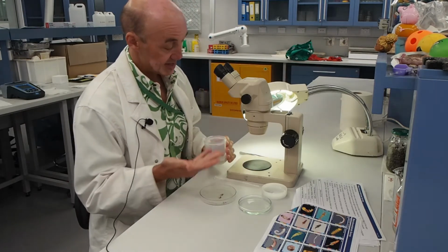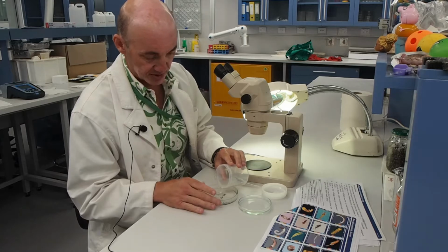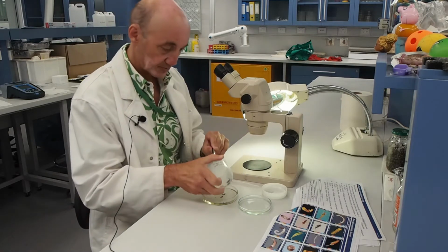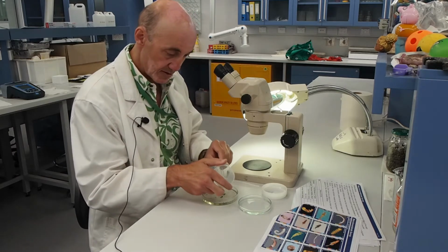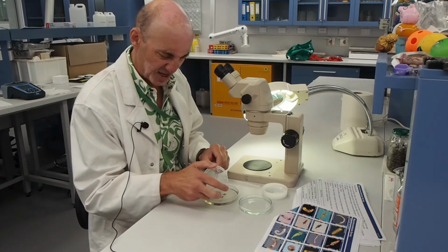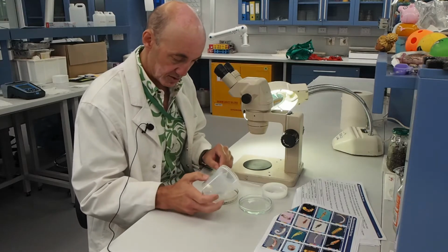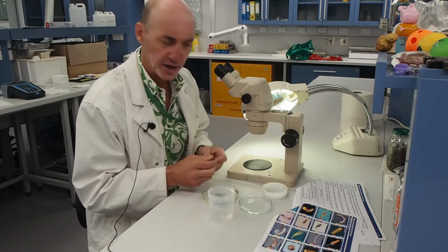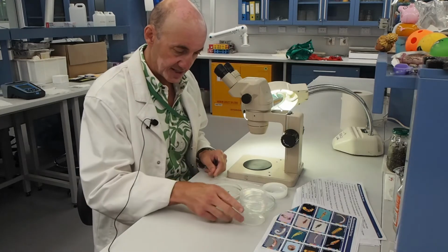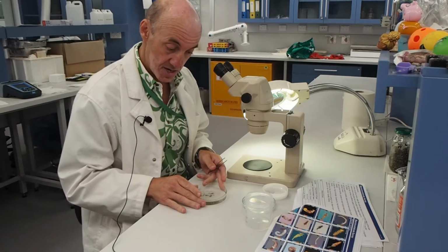We're here in the lab, and I've just got a dissecting microscope. This allows us to see a bit more detail, and I'm pouring the sample in. Hopefully it doesn't flood. Try and get all that out into our jar. Even though we've done a live pick and everything in here should be an organic specimen, sometimes you can't see as well, so we need to confirm everything we have. So here's our sample. This is from Yosemite Creek, and you can see the sample there.